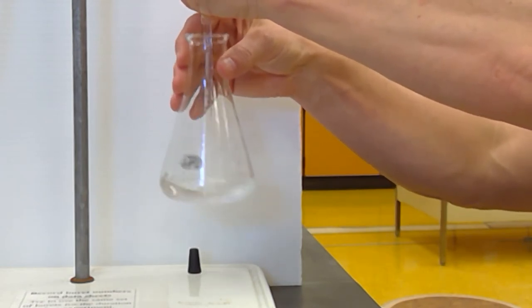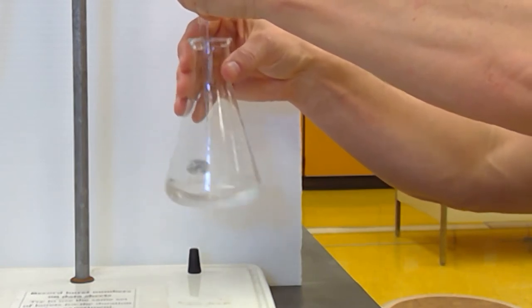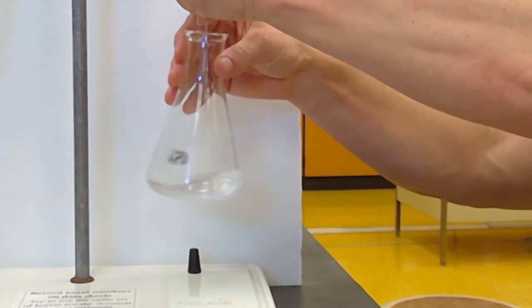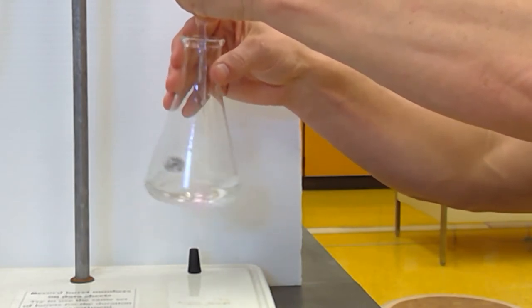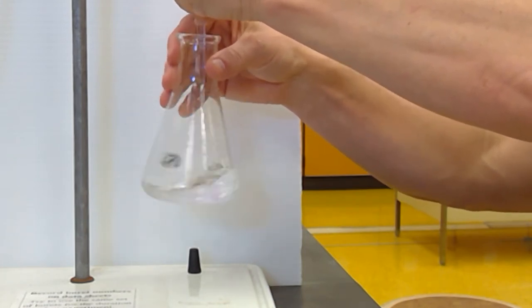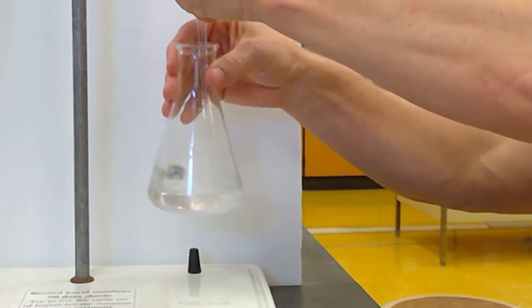Sooner or later, now with phenolphthalein, obviously it turns pink in basic solution. If you're using different indicators, you might get different colors. But swirl it, swirl it, and you start to see that pink forming. I'm not going to slow down at all. I am not trying to hit the faintest pink color. Can you see the pink forming? And then going away. I'm just going to add until that stays pink. Again, not trying to hit the faintest endpoint possible.